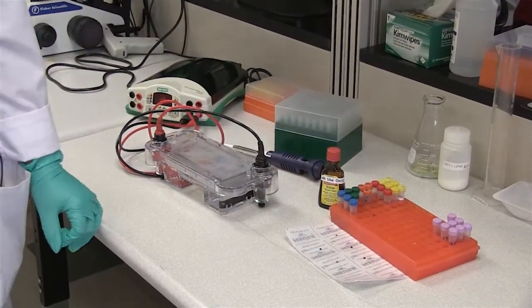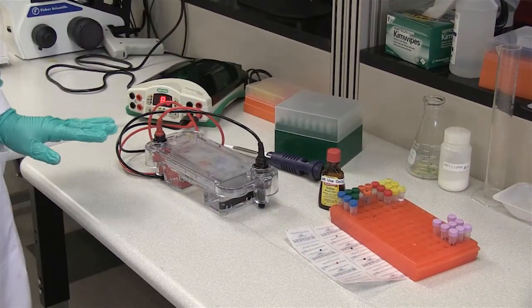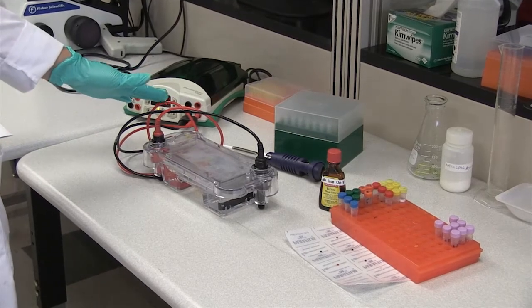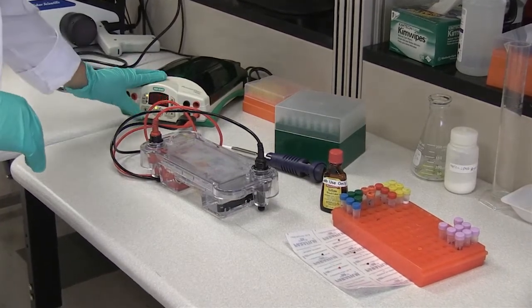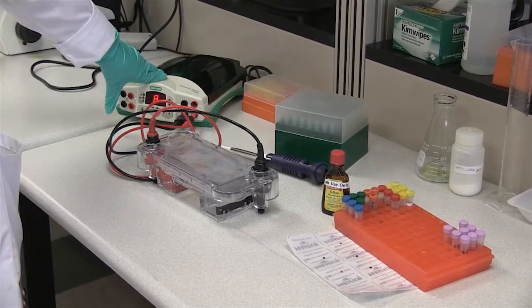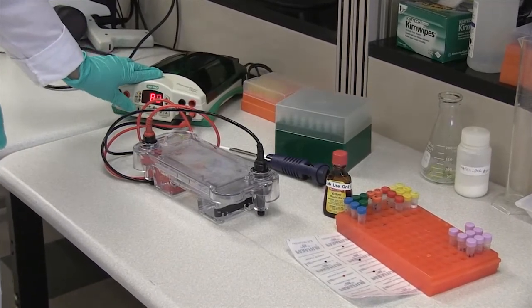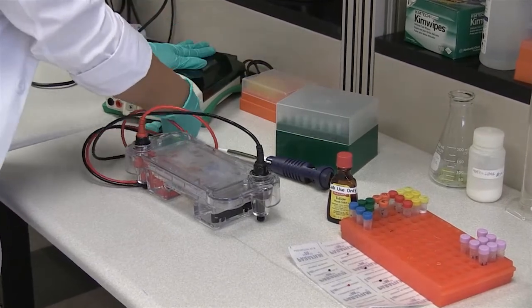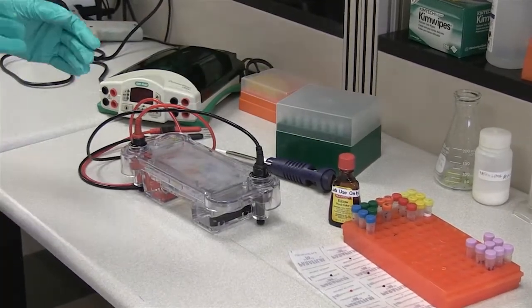So now that it's been 45 minutes, we're going to go ahead and cut off our machine. The number one thing that you need to do is make sure that you do turn your machine off and hit stop. If you do not do that, I always like to also turn off the machine and unplug to be safe, because you are dealing with electricity.